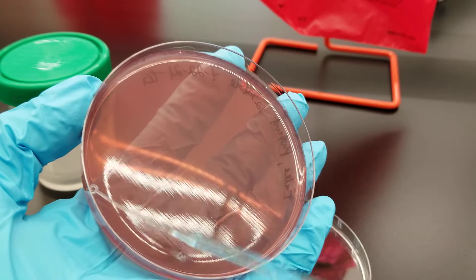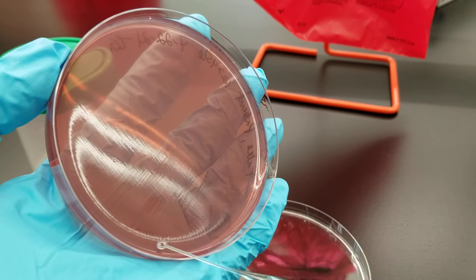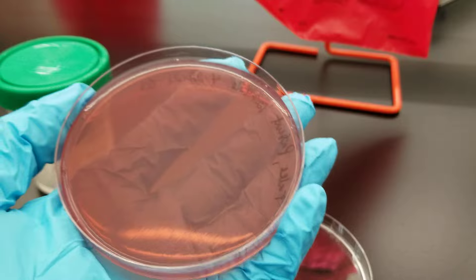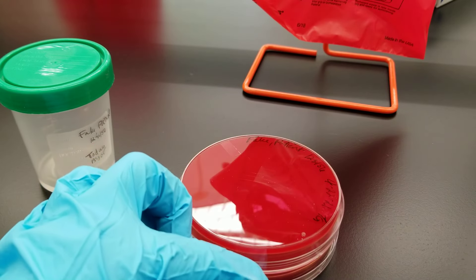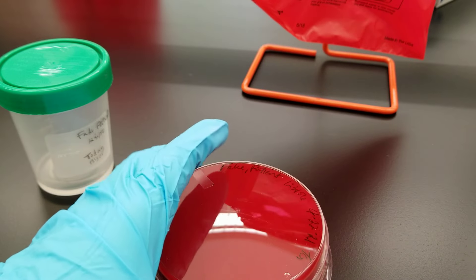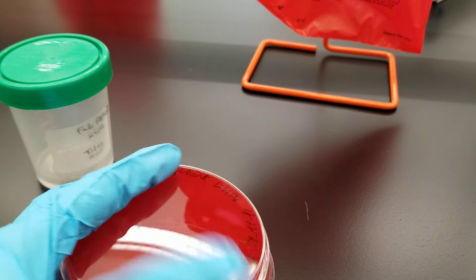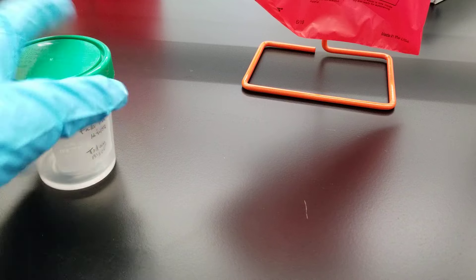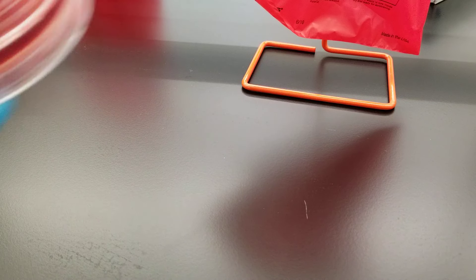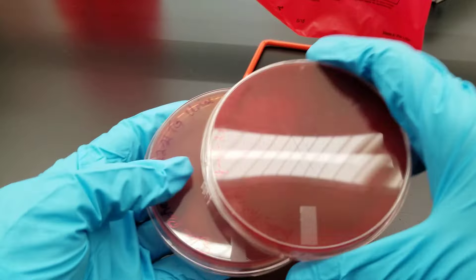That is why we follow the blood, chocolate, MacConkey streaking order, and the same applies when you go to any other plating setup like the anaerobic setup — there's always an order with the most inhibitory agar being last. So here we would end up putting these into a media holder and placing them in the CO2 incubator for 24 hours. You may also choose to do a 48-hour check after that. So these have been incubated in the CO2 incubator for 24 hours.